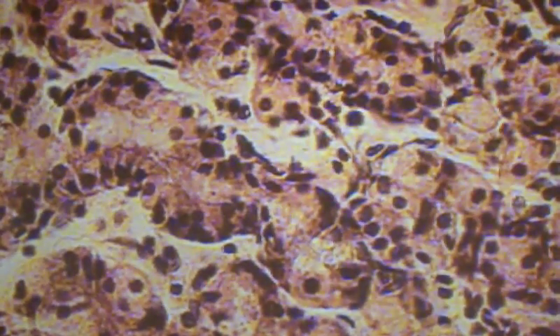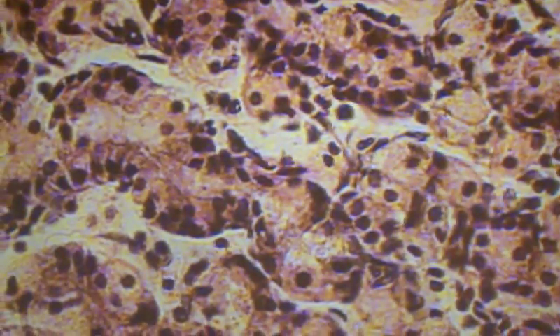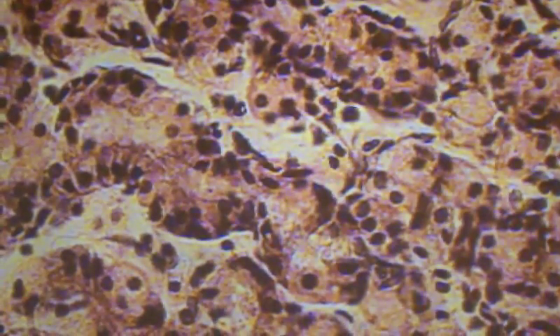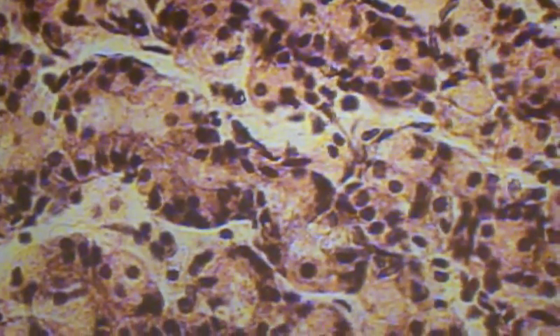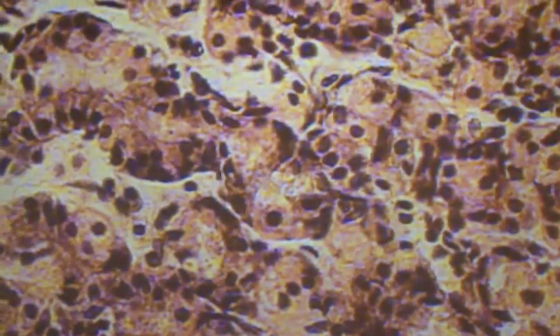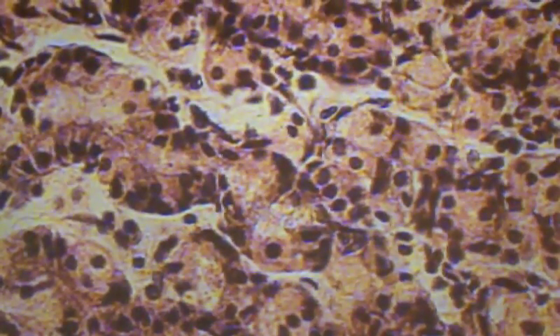This slide I have for these particular cell types — if you want, look at a different slide to perhaps see a better view. There should be good pictures in your atlas too. But look for fried eggs — if you're seeing those fried egg cells, then you've got those parietal cells. The chief cells are irregularly shaped, with much less cytoplasm, and the cytoplasm you do see has obvious grains in it.